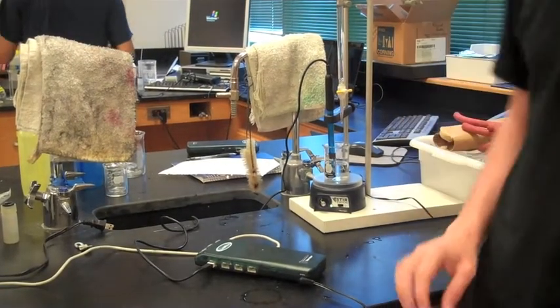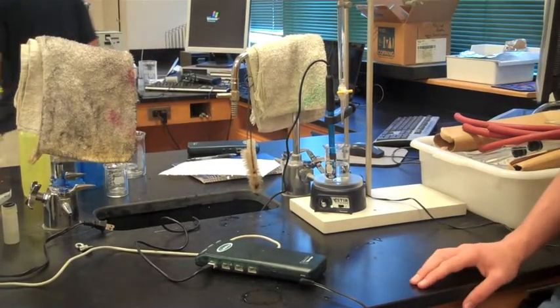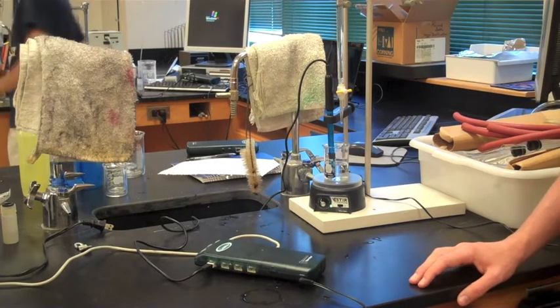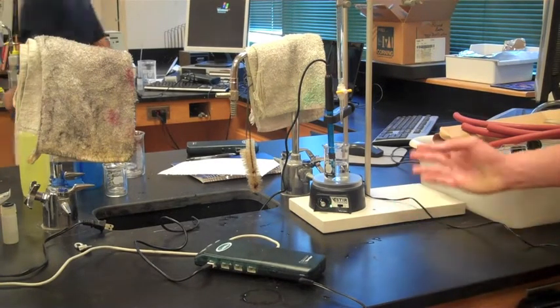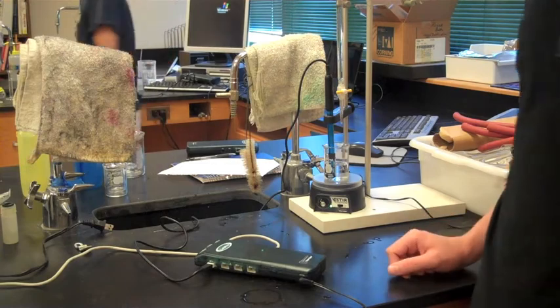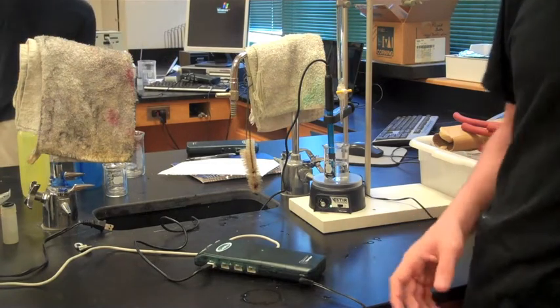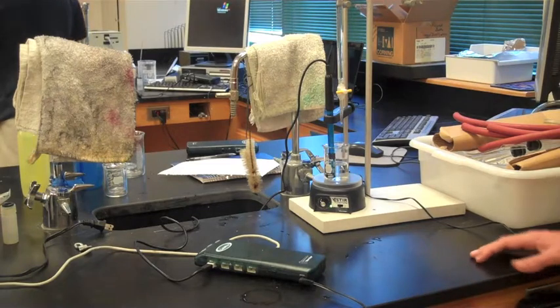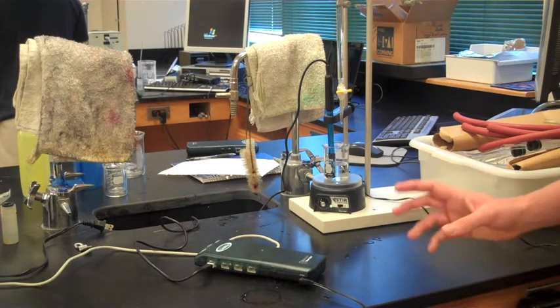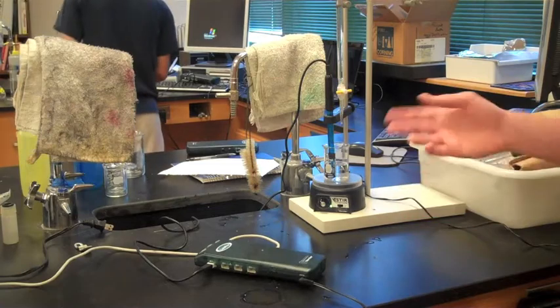Hello, this is BAM Science, and today I'm going to give a demonstration of buffer solutions. A buffer is basically a solution of a weak acid and a weak conjugate base. When a strong acid or base is added, the buffer solution neutralizes it without any drastic changes in pH.